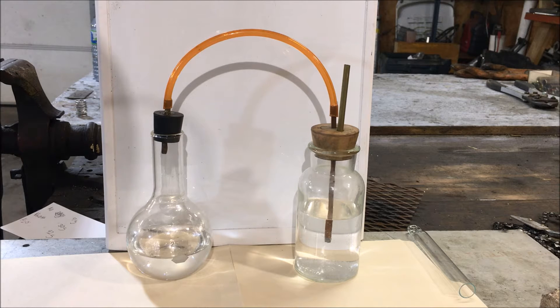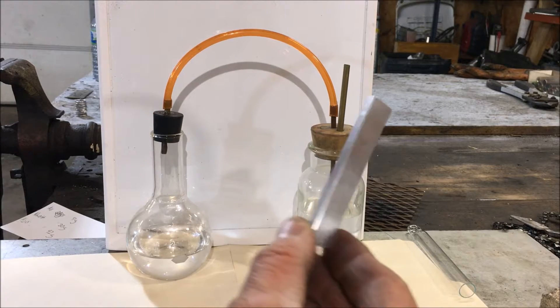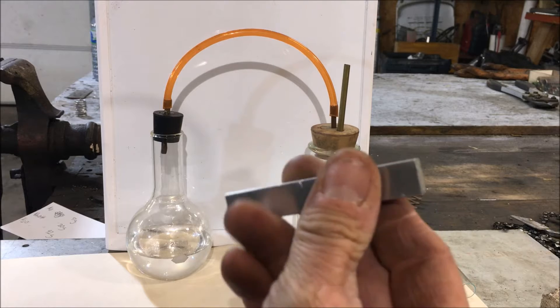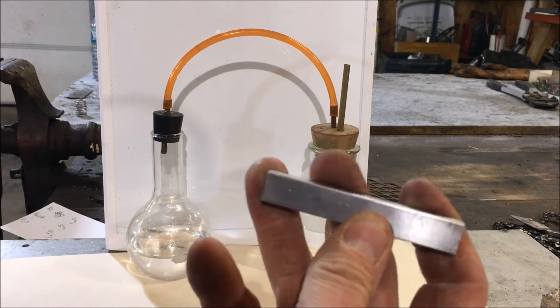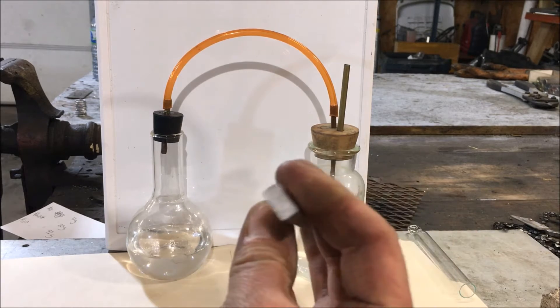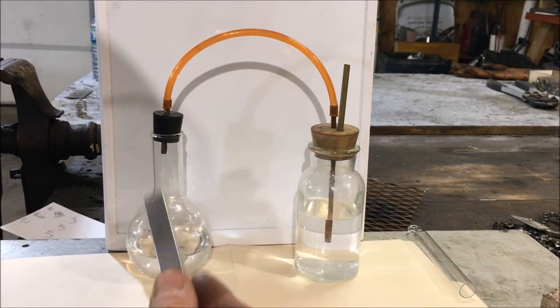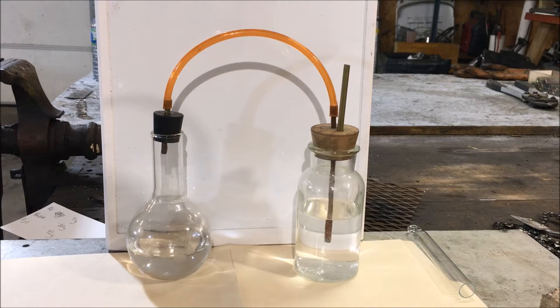In this test tube test, I wanted to observe the amount of hydrogen liberated in a reaction using this 16 gram bar of aluminum. This is probably not pure aluminum — I don't know what it's made out of, I'd imagine it's some kind of magnesium alloy. We're going to react it in this flask which contains 30 grams of sodium hydroxide and 92 grams of water.